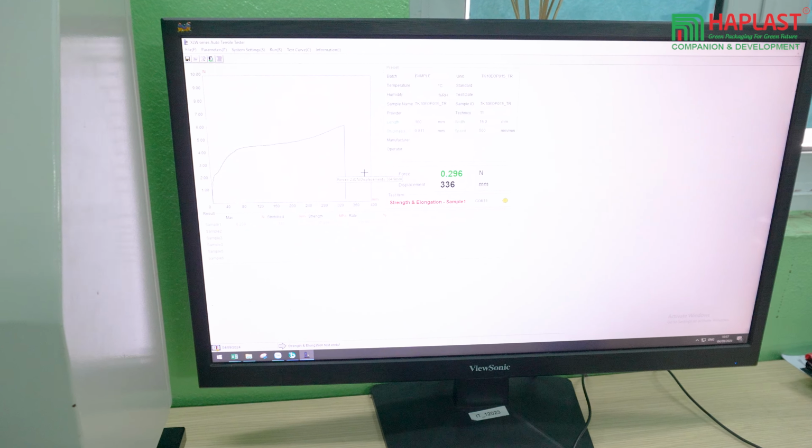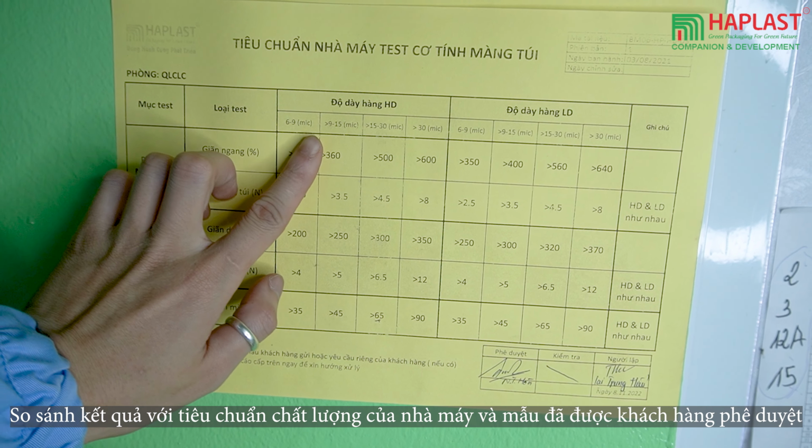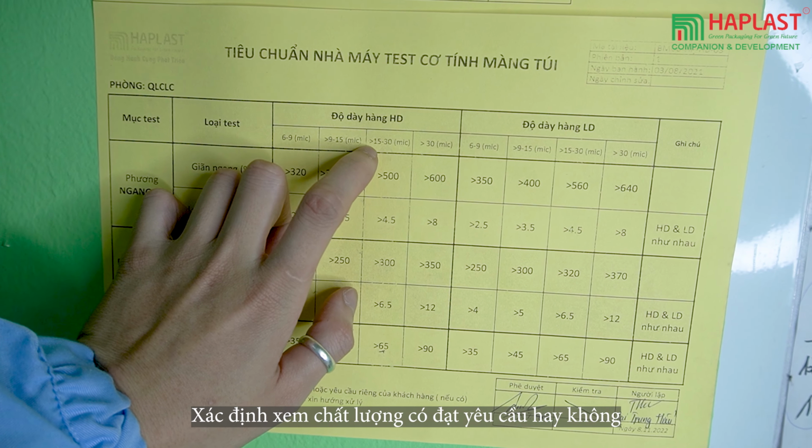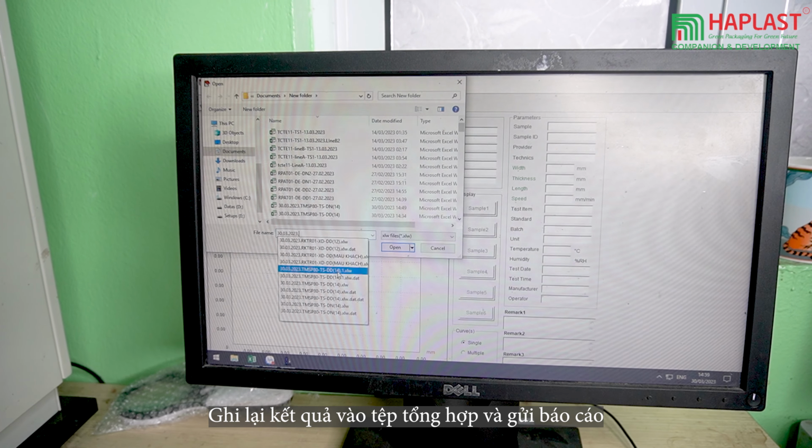Step 4. Evaluation. Compare the results to the factory's quality standards and the approved customer sample. Determine if the quality passes or fails. Document the results in the summary file and send the report.